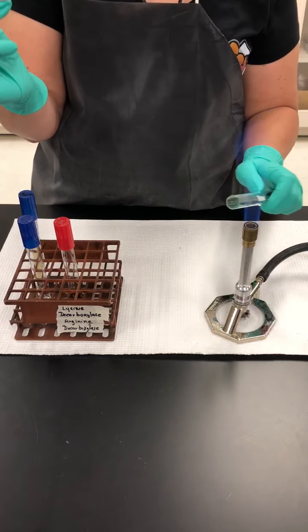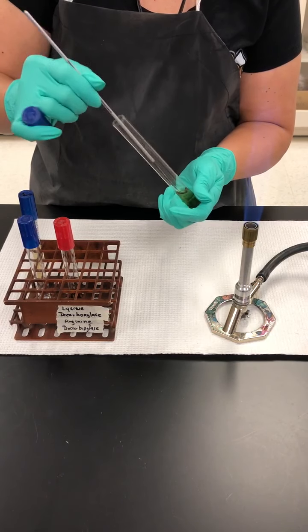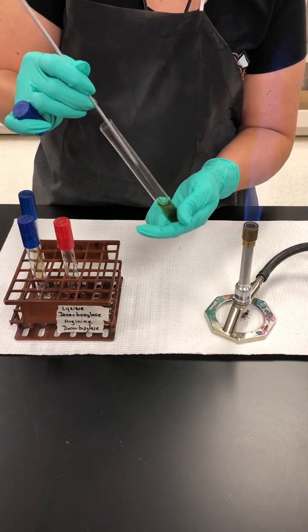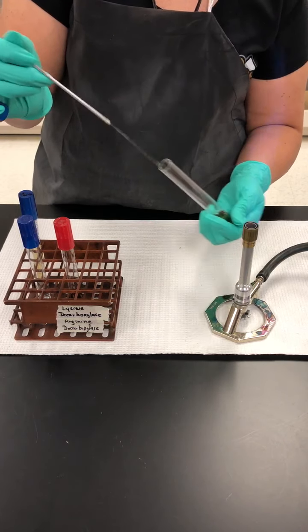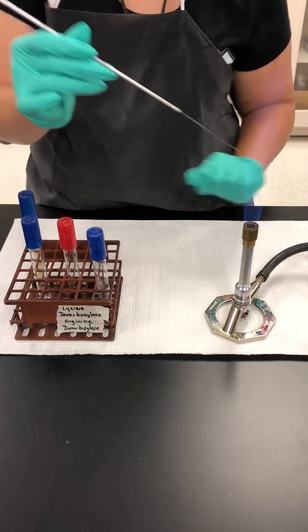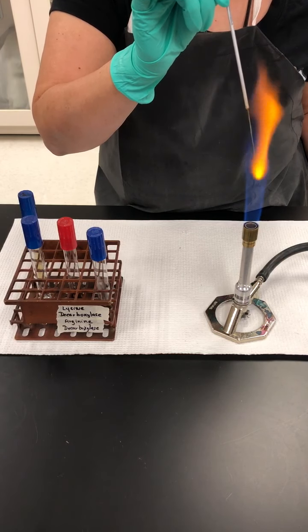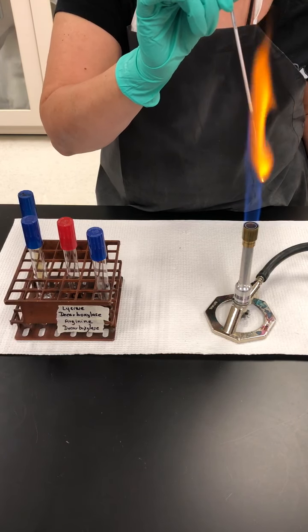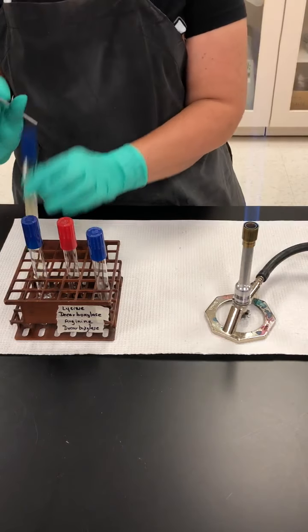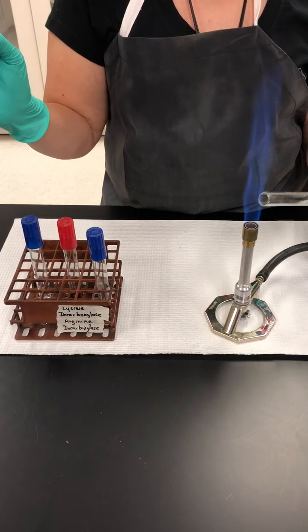I'm going to inoculate the lysine decarboxylase broth first. That means that in this tube, the amino acid that we added to the base recipe of the media was lysine. I'm going to incinerate my loop thoroughly in between inoculations, even if I am working with the same bacteria. Let's pretend that I waited 10 seconds.